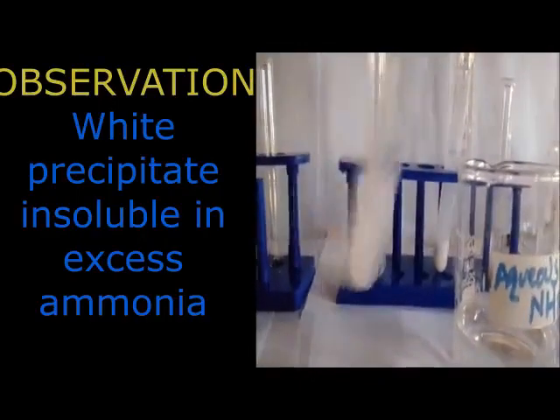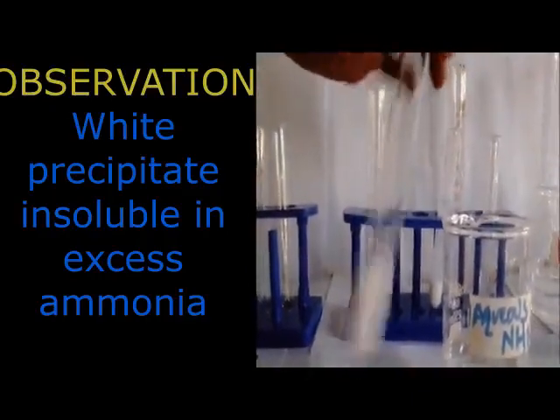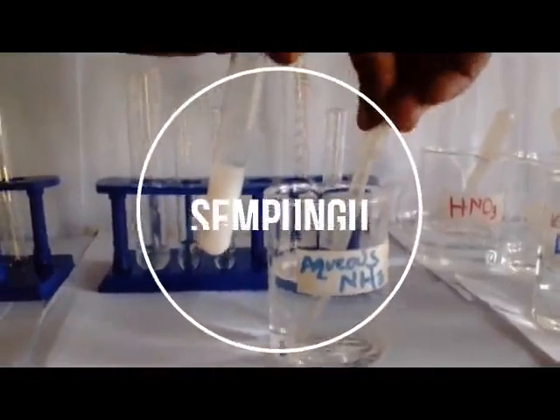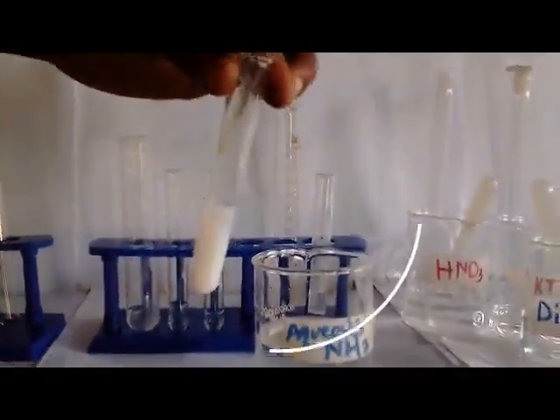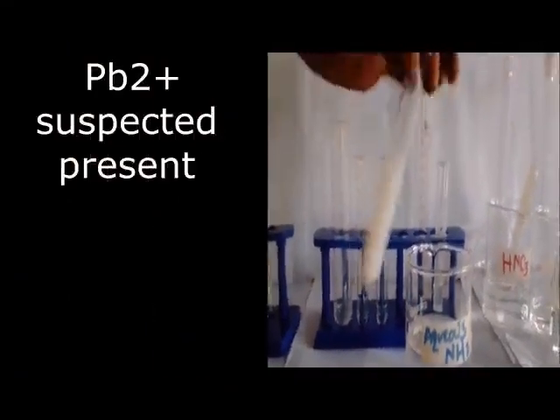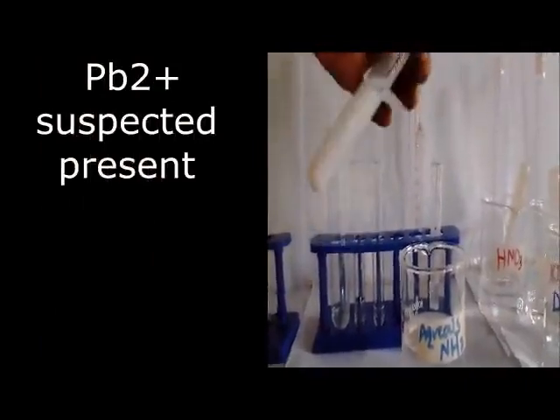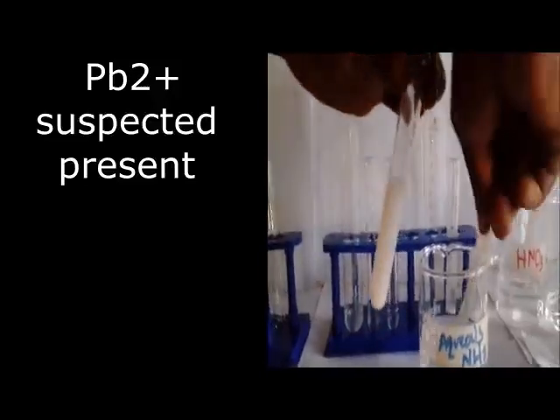So we continue adding to prove that it doesn't go away. We are adding more, and you can see the precipitate persists there. This implies that we are going to record our observation: white precipitate insoluble in excess ammonia. Don't forget that. That is going to be our observation.